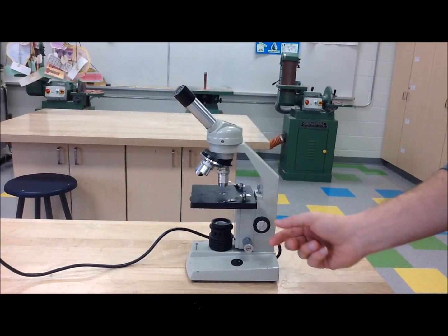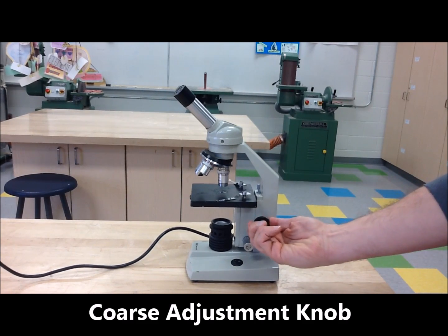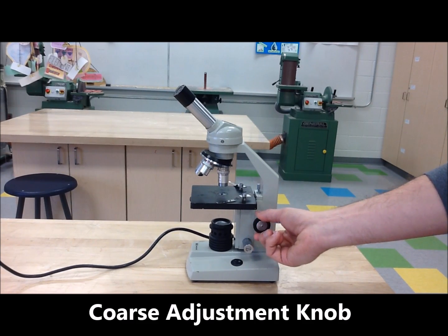Coarse Adjustment Knob. It's used to move the stage up and down and focus on the specimen.